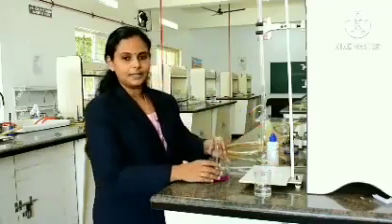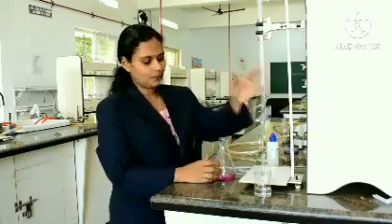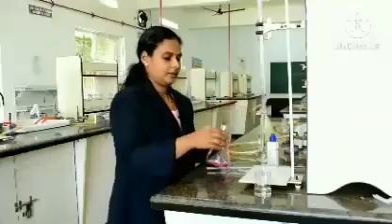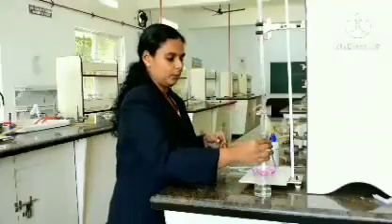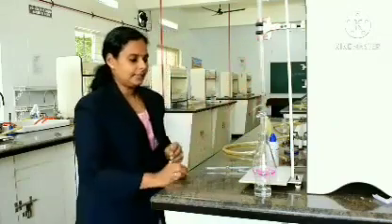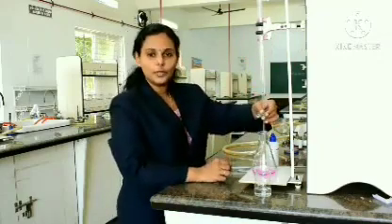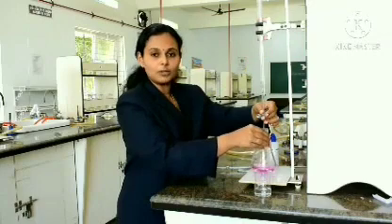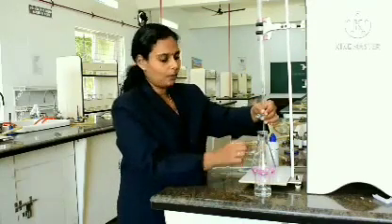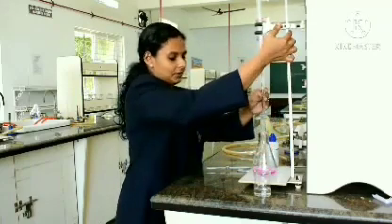Now, we are going to start the titration. We are going to react the acid with the base. This process is called titration. Just keep it below, adjust the burette. So, when you are handling the burette, keep your left hand for controlling the knob, and the flask has to be constantly stirred. So, always remember the left hand for controlling the knob and right hand for stirring. So, let us start the experiment.